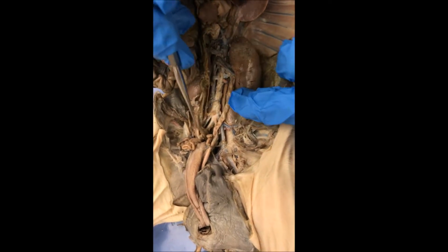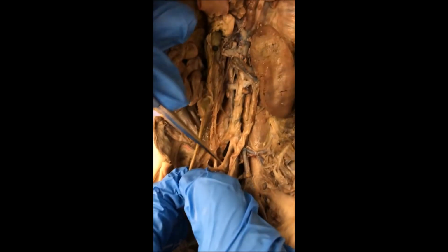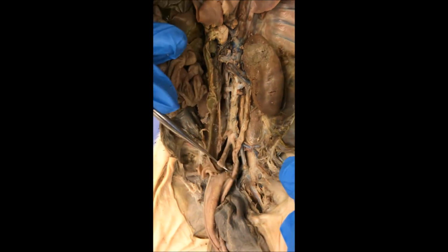This is, where is it? Right here. The IMA. Omar, can you put him back?